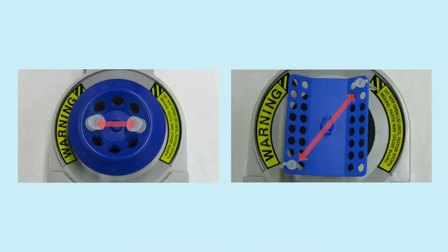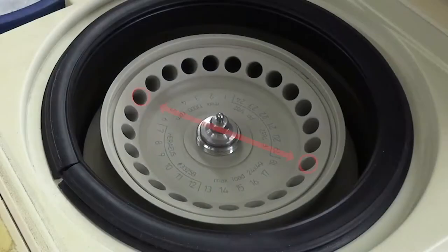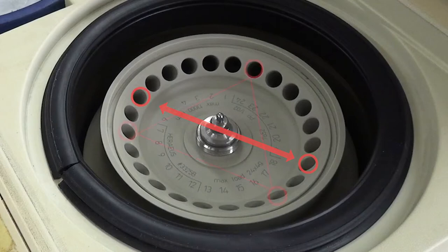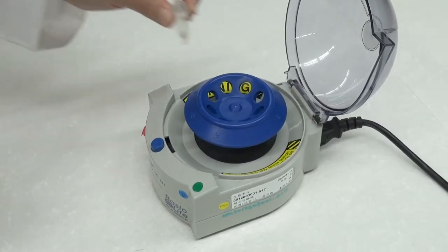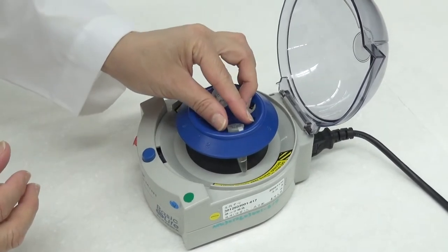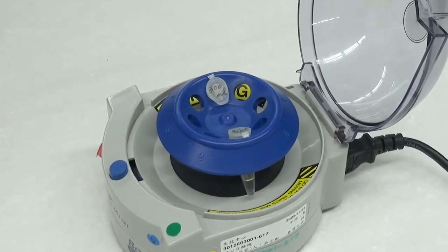The placement of centrifuge tubes must allow weight to be symmetrically balanced. Solutions of equal volumes should be placed symmetrically across from each other or in a symmetrically equilateral triangle. When there are an odd number of samples, an additional tube containing clear water of equal volume can be prepared and used to maintain symmetrical balance.